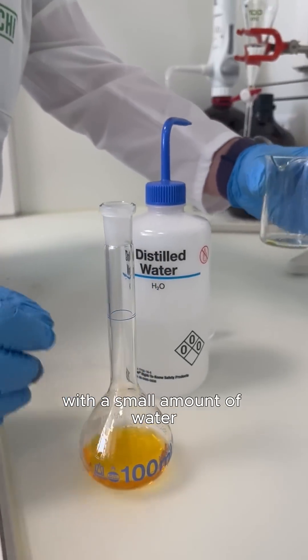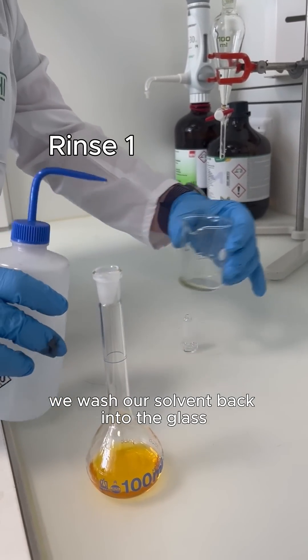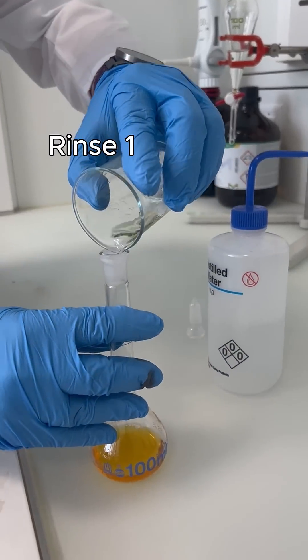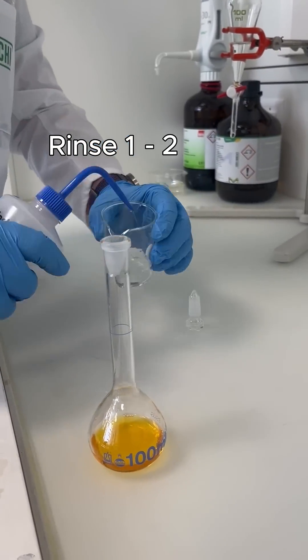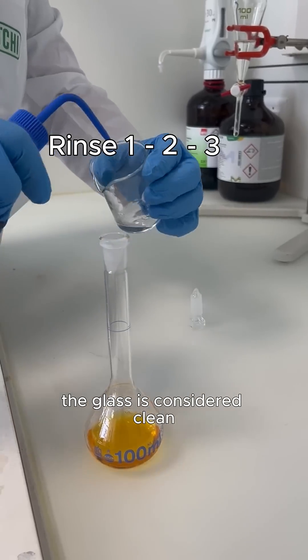With a small amount of water, we wash our solvent back into the glass. After the third time, the glass is considered clean.